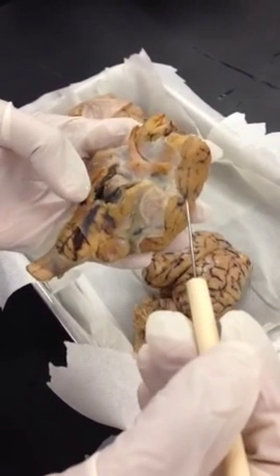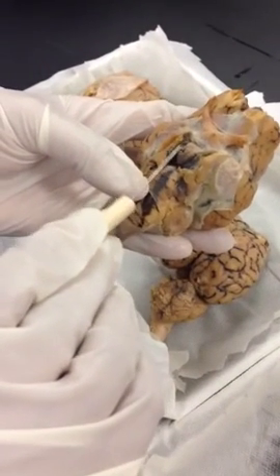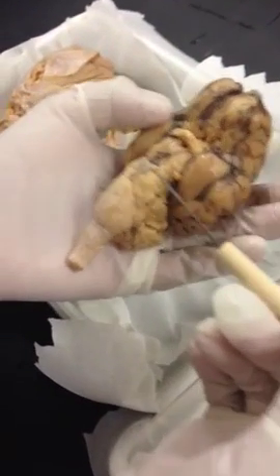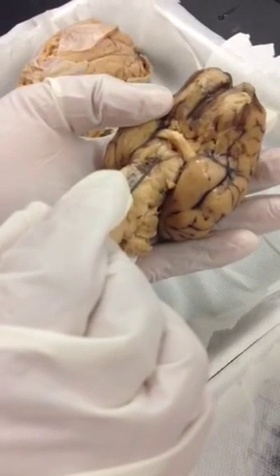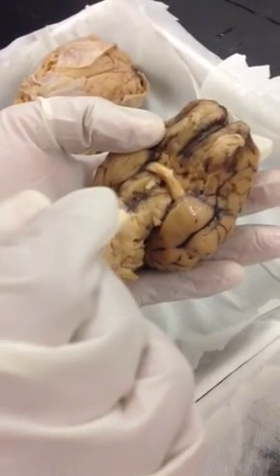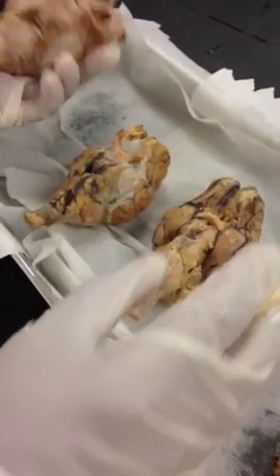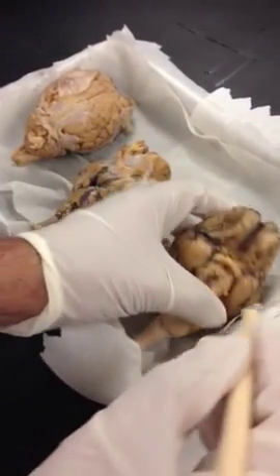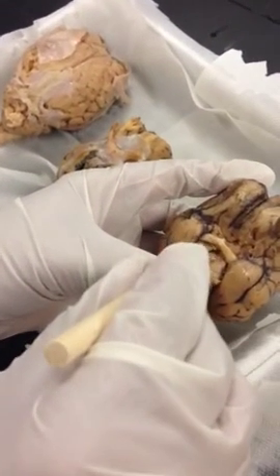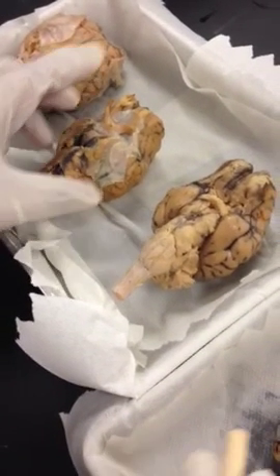Mammillary body. You cannot see the mammillary body in this view because the pituitary gland is hiding it, so you have to find another brain where the pituitary gland has been removed. So you can see here the optic chiasma, and there's a little hole representing the infundibulum, and this is your mammillary body right here. Infundibulum is the stalk of the pituitary gland. It's broken off in this specimen, so you can see where the infundibulum was attached. You see the hole that represents the infundibulum.